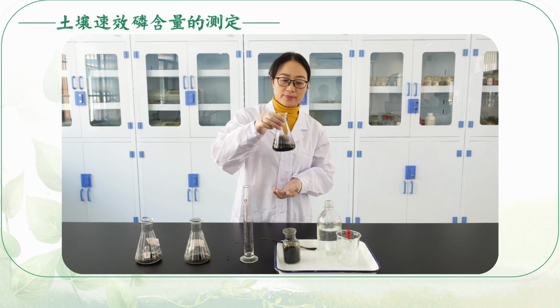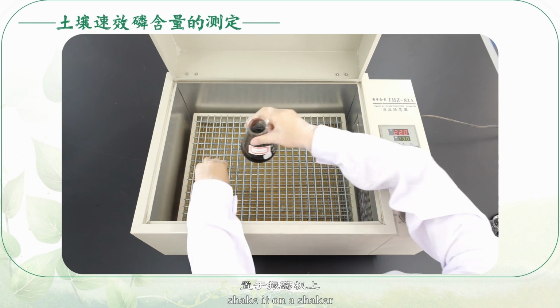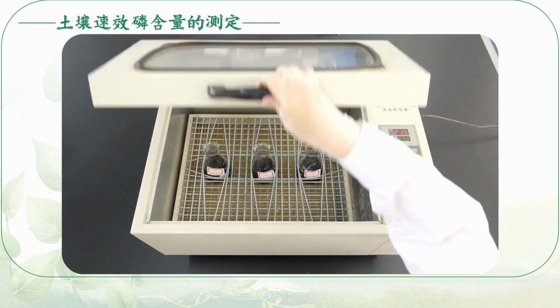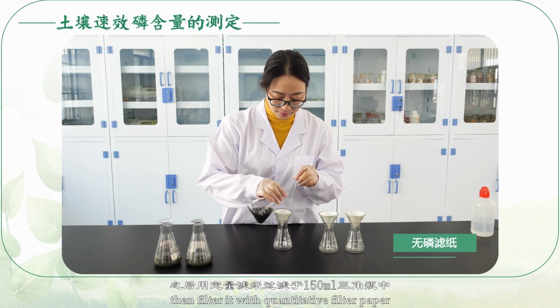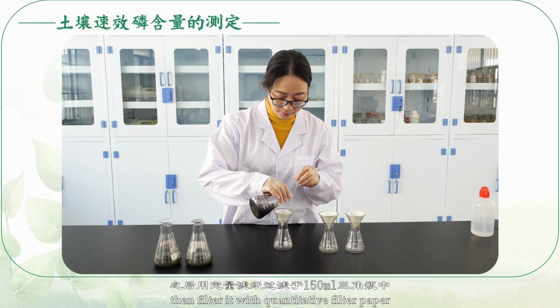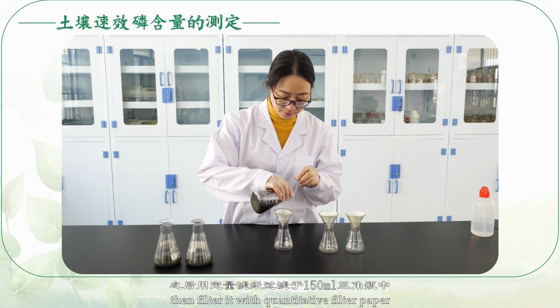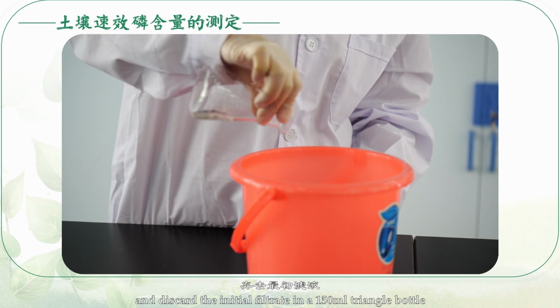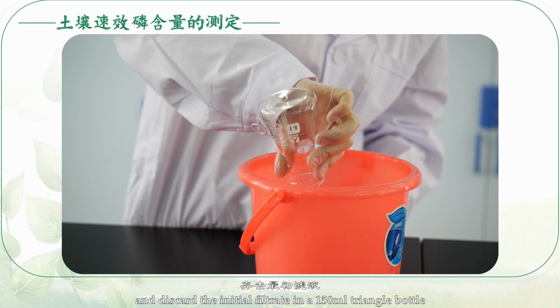Shake it slightly. Shake it on a shaker for 30 minutes. Then filter it with quantitative filter paper and discard the initial filtrate in a 150 milliliter triangle bottle.